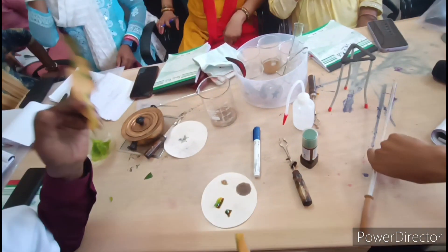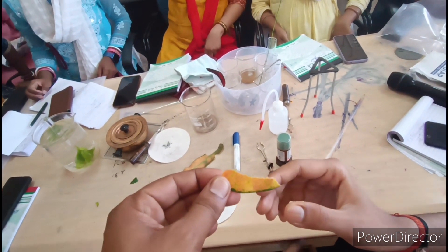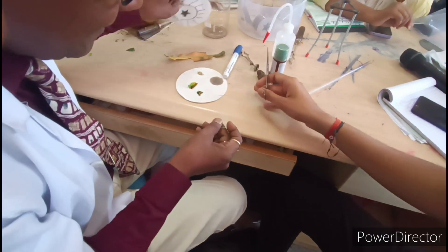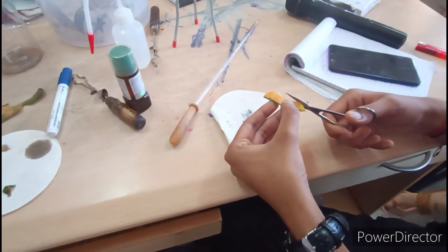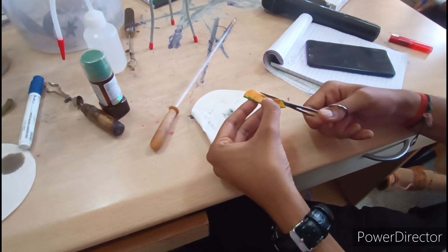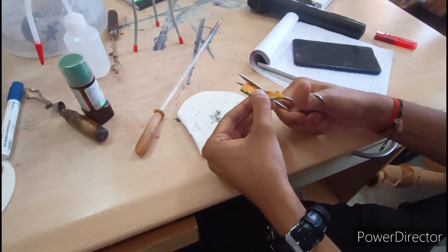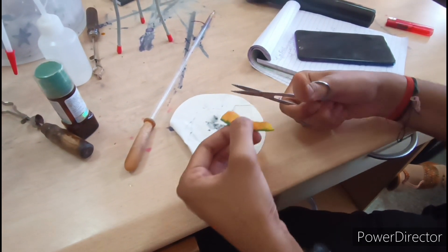Do you want to do this? The scissor is below — use the blade. It's a transparent layer on the slide. It's a good peel — how much of the leaf is done? It's a big leaf. Why do you get so much of the leaf? It's a little thick, but it's good. You can do it — how much of the leaf is done?